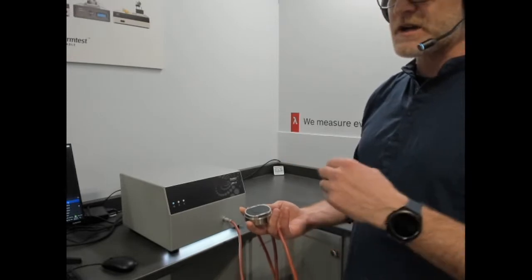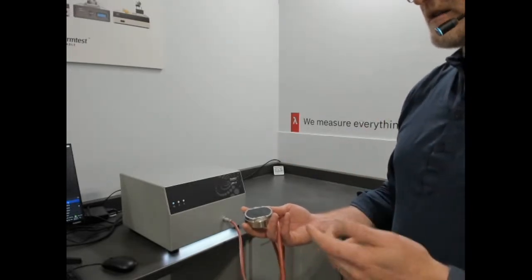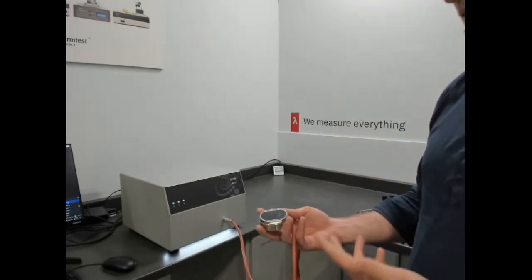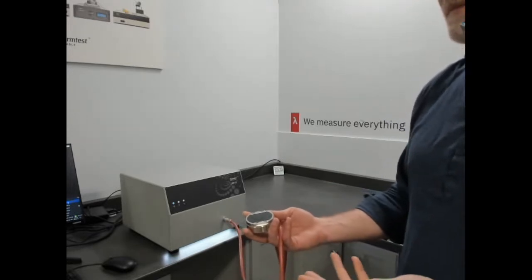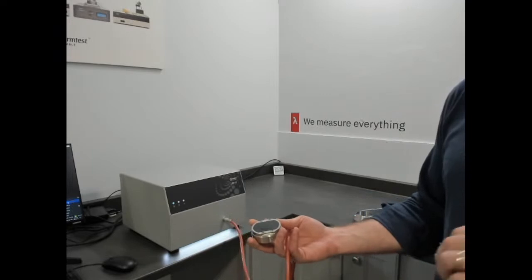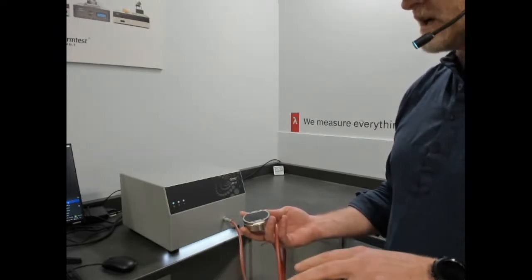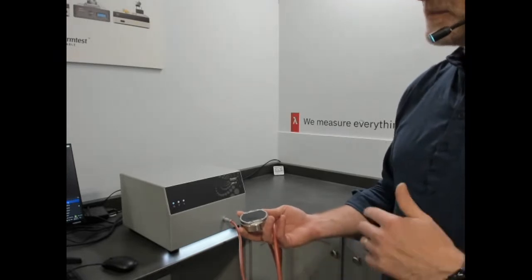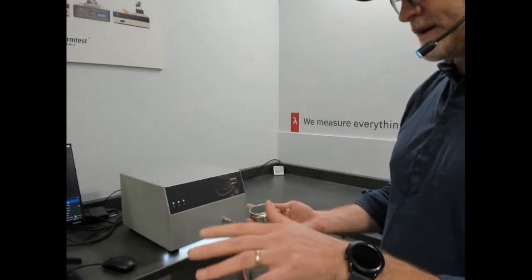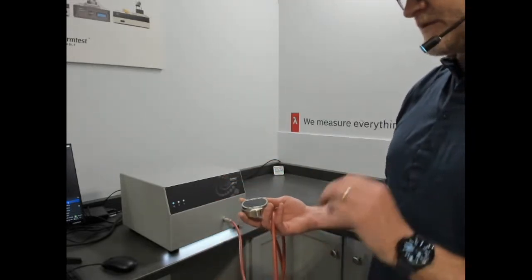So for thermal effusivity by ASTM 7984, I did a demonstration or discussion, a deeper dive, on what that really is used for, and I'll repeat some of it. It's basically thermal effusivity to that committee, and the use of fabrics is to measure the sense of coolness or warmth, mirroring only a short test time, so contact of a momentary 1 to 3 seconds roughly. And it's qualitative in nature.